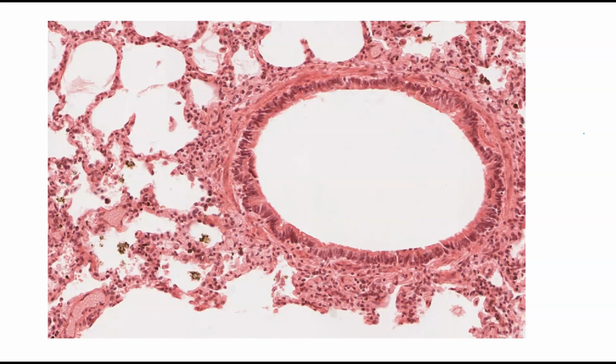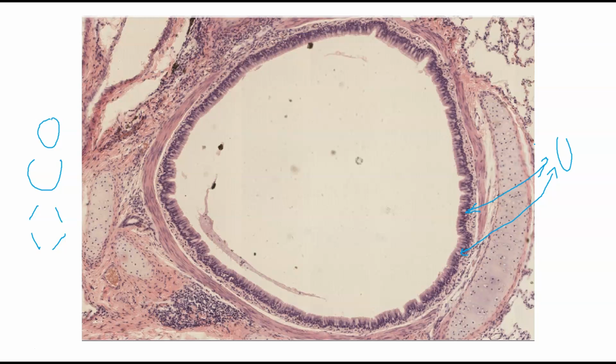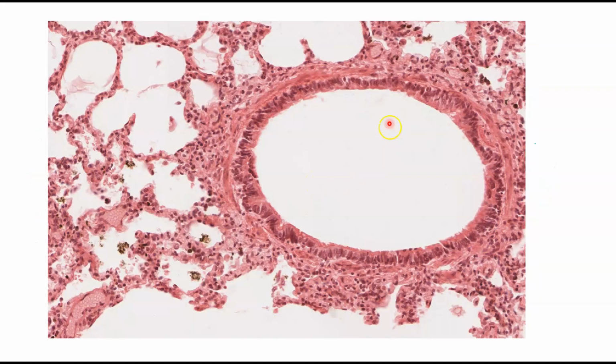So this final picture is going to be a lot more zoomed in than our previous picture was. All right, so this is zoomed out. This here is going to be something like a scanning microscope. You're getting into your high power, 400 times magnification, even more than that. So we are zoomed in here, zoomed out here. So we have zoomed into smaller structures.